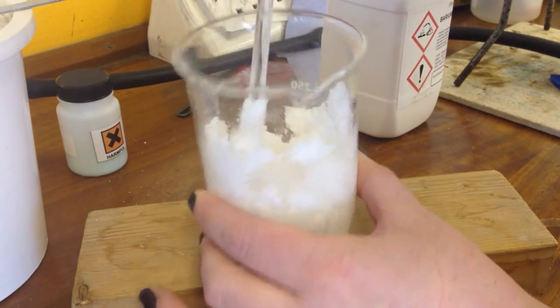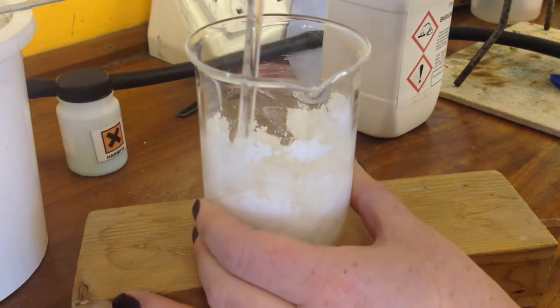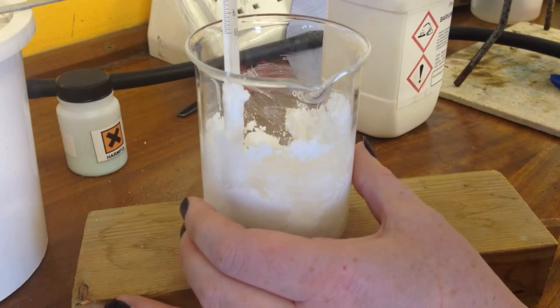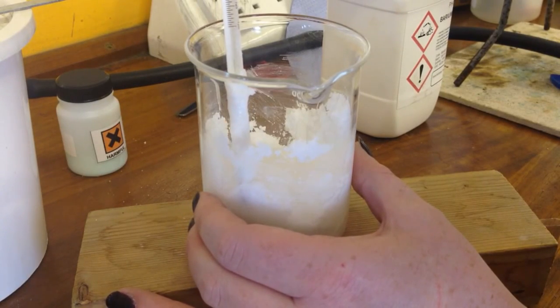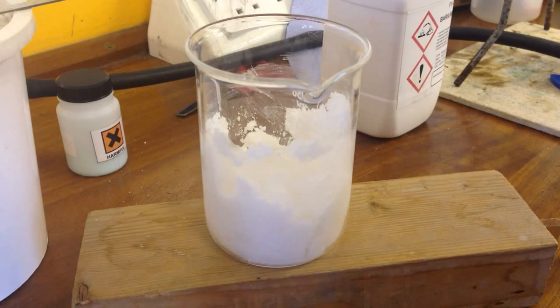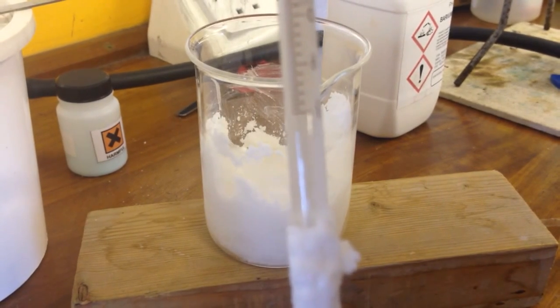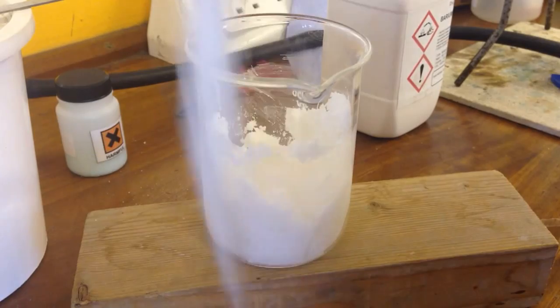And it's a bit hard for you to see in there, but they're not powdery. It's kind of like a bit of a mush at the moment. And the temperature has already dropped. If I can just bring that closer and try and show you, the temperature has already gone below minus 10 on this.